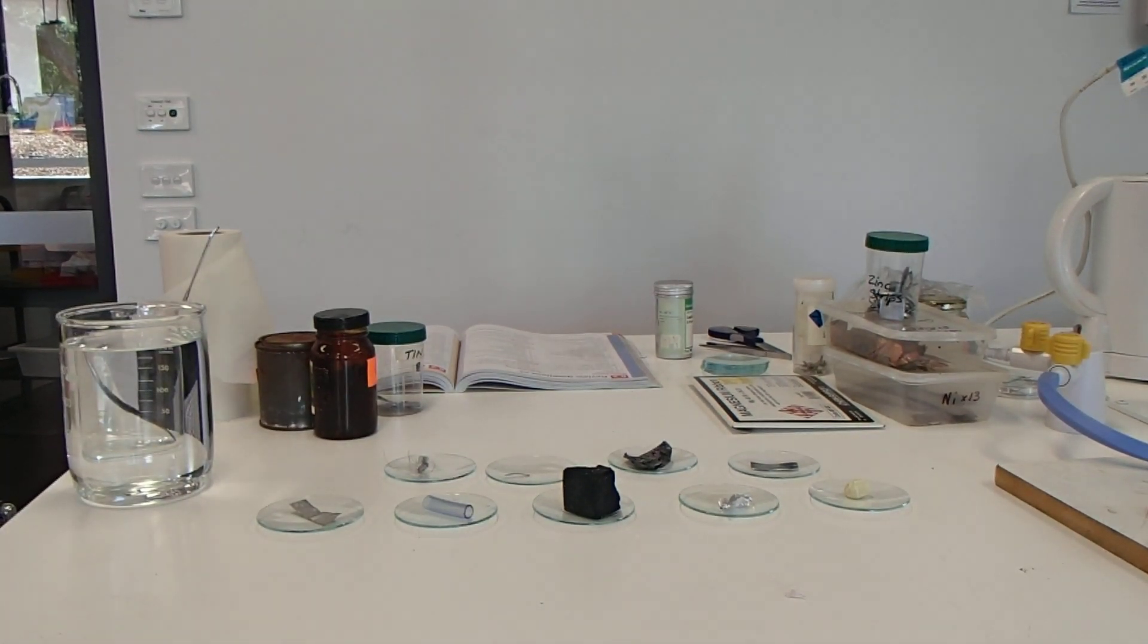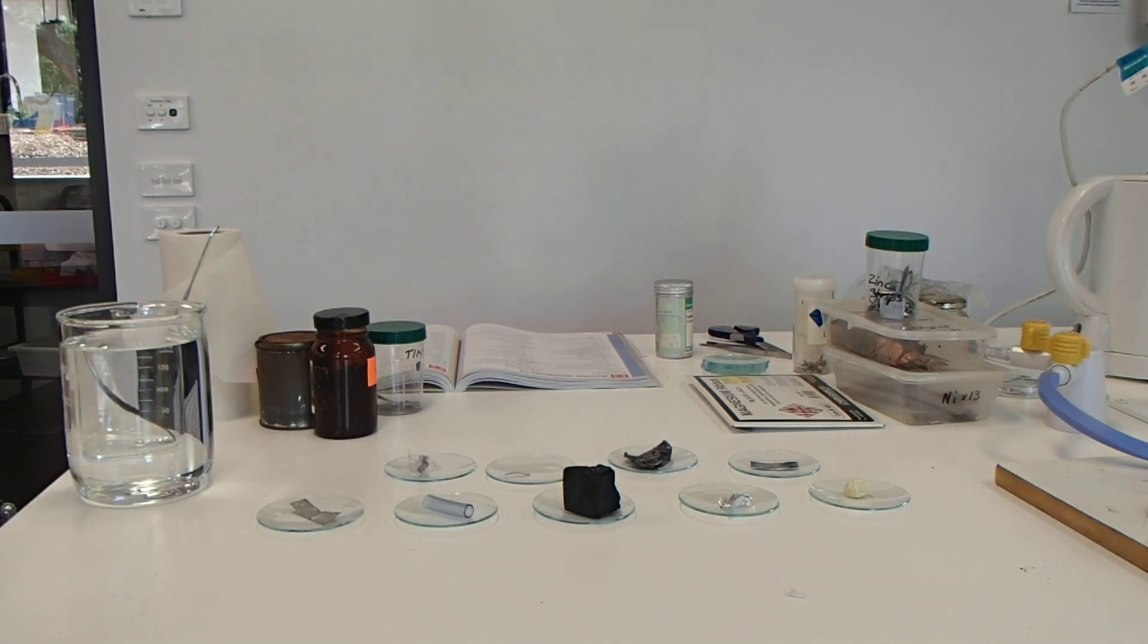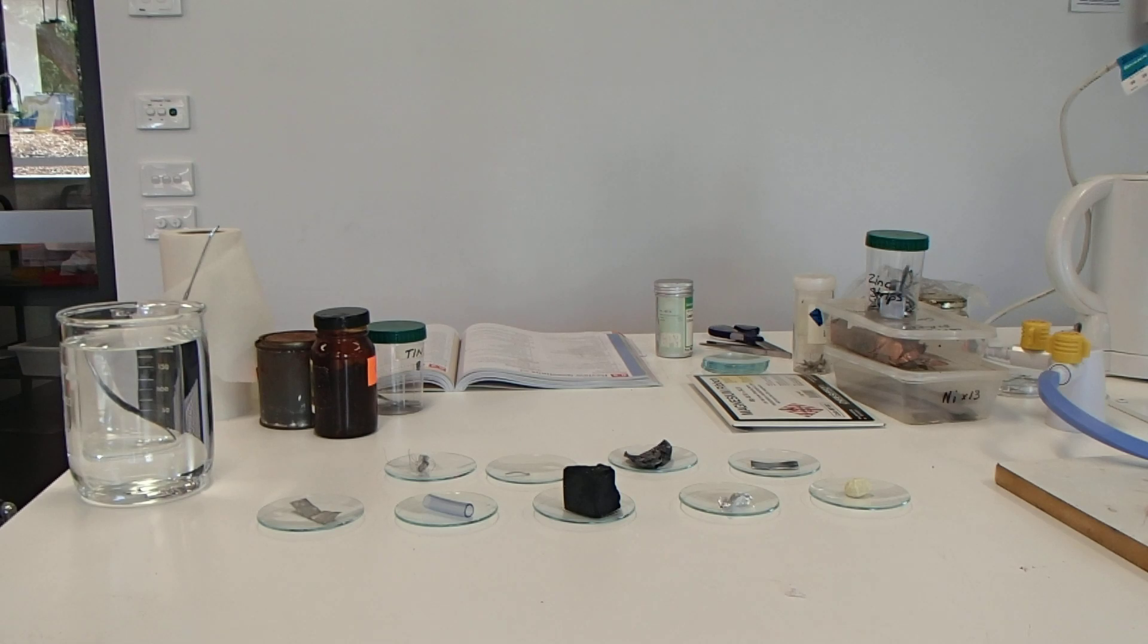Hello again, and here we are. We're going to be doing practical 5.2, which is the properties of elements. Today we're looking at the physical properties of metals and non-metals, and perhaps some metalloids we've got in here.